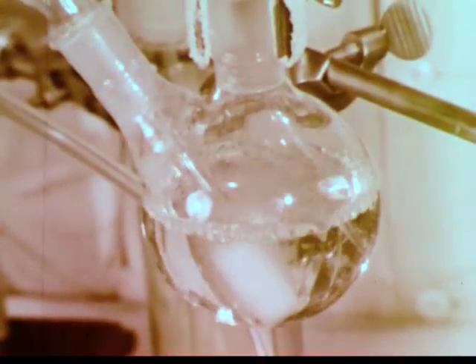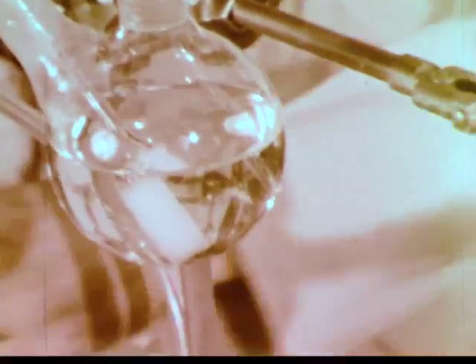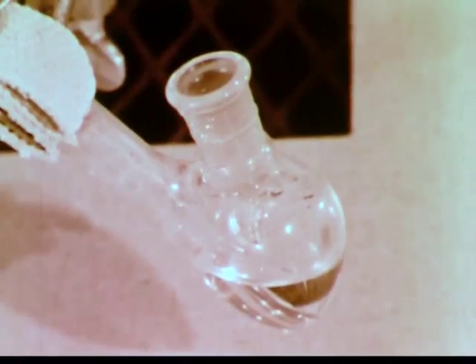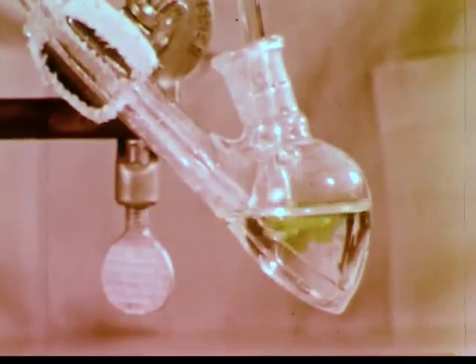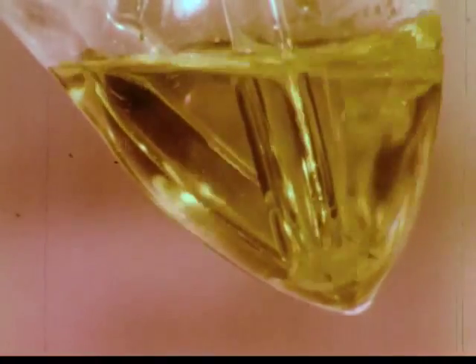After a few minutes, the seawater solution loses its color, showing that the bromine has been blown out. Because of its high solubility, the hydrogen bromide which was formed should have collected in the water in this receiving flask. To check this, we again use chlorine to oxidize the hydrogen bromide in the receiving flask. The characteristic color of aqueous bromine appears. The bromide ions in the hydrogen bromide solution are oxidized by chlorine to produce elemental bromine. Thus, we have succeeded in concentrating the bromine from the seawater in a much smaller volume of solution.